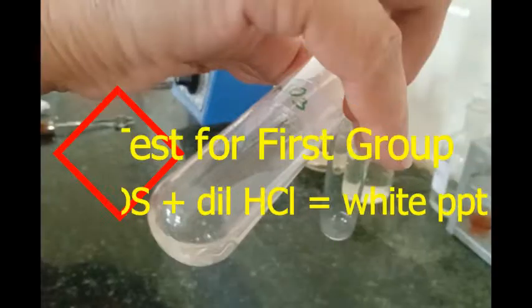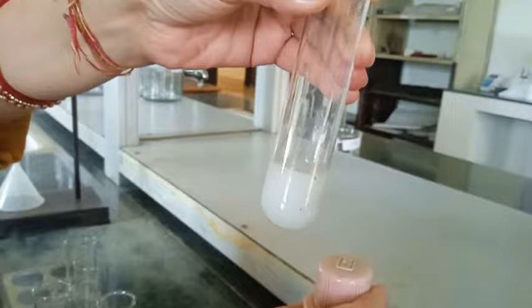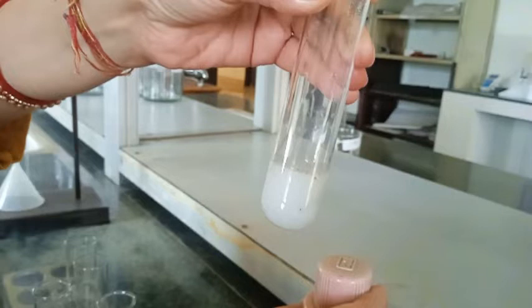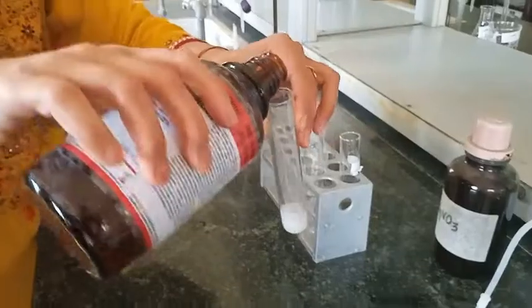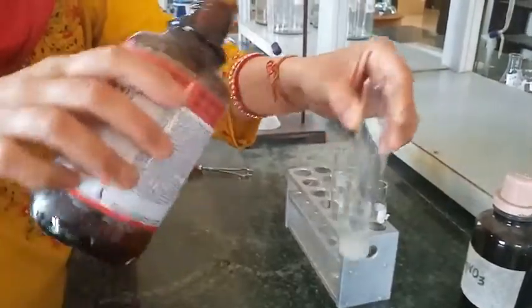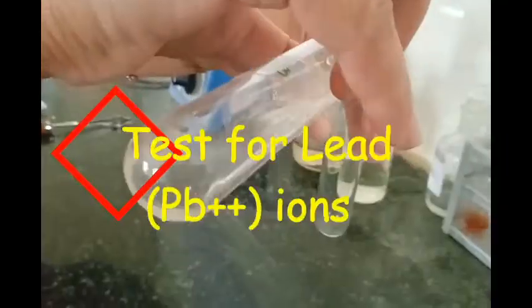Now, test for the first group. The group reagent for this is dilute HCl, and we get a white precipitate. In this group, we have lead, silver, and mercury. If the white precipitate is soluble in hot water and insoluble in cold water, that confirms lead. If it is soluble in ammonia, that confirms that silver is present.